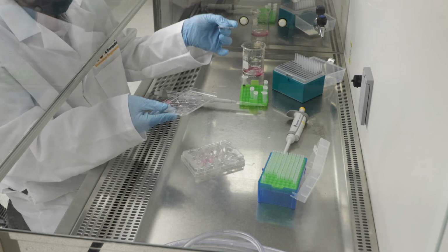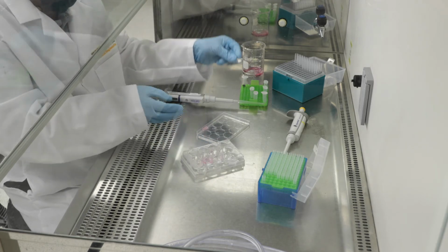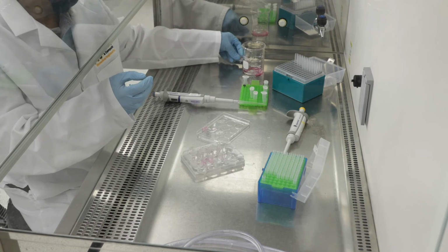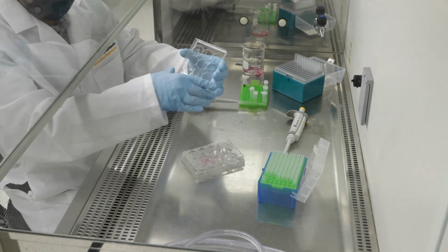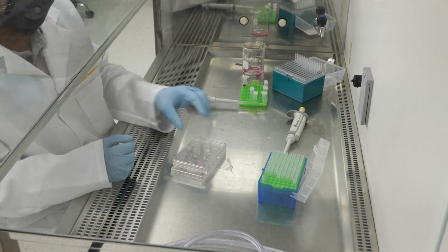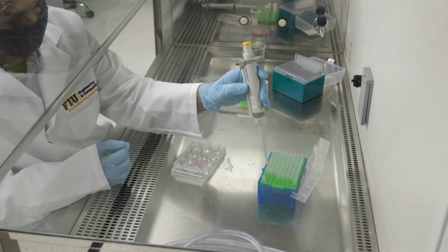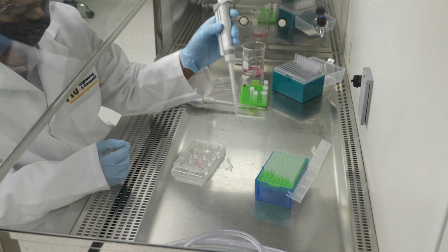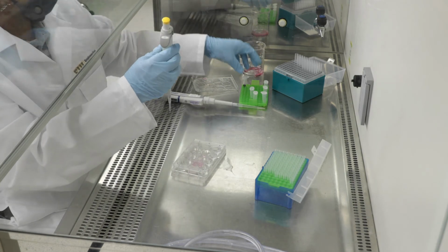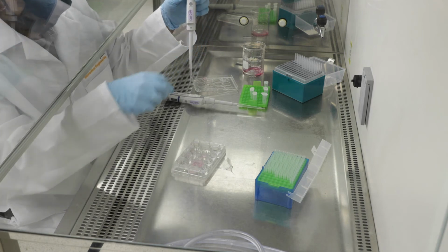One important thing to keep in mind is that it's important to know what the area of each of these sections is, because you want to be able to report the cell density per unit area. Each section is very irregular, so when you look under the microscope, make sure you can use the microscope software or any image processing software to measure the area within the region of interest. So you can report your cells as a density, in terms of X number of cells per millimeter square, for example. All right, so now I'm getting ready to get the trypan blue out.